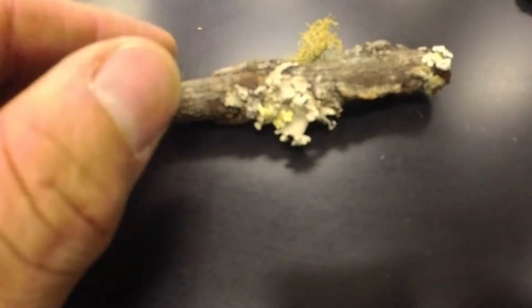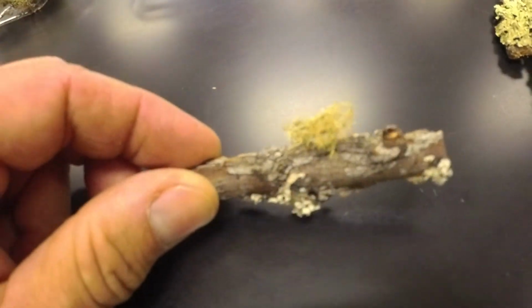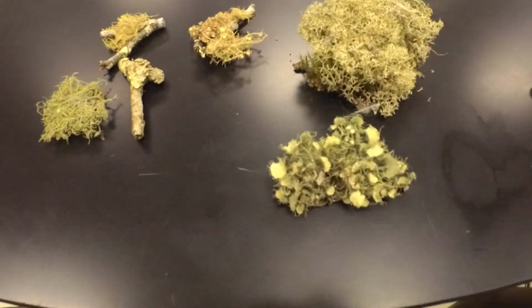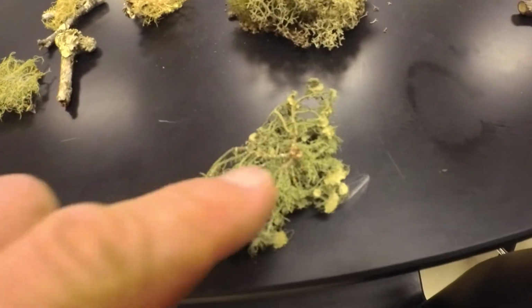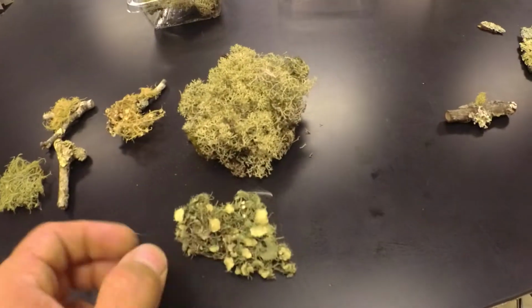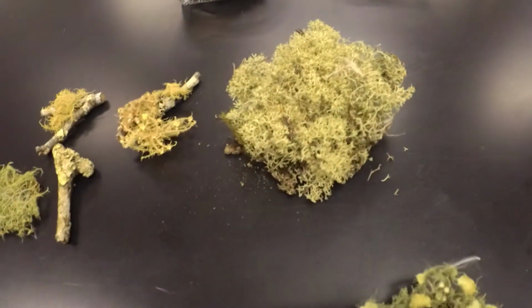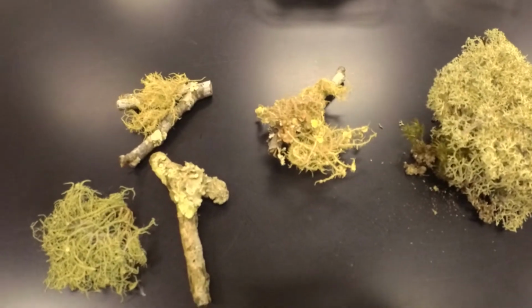And here is a twig with some foliose and our next body plan of lichen, the fruticose. So these are fruticose lichens, and you can see that these are very three-dimensional. Here you can see the stalk where this thing attaches to a substrate and it sticks up above. So much more three-dimensional with fruticose lichens. This is reindeer moss. You've probably seen this growing on roadsides before. It's quite thick. So there's a couple examples.